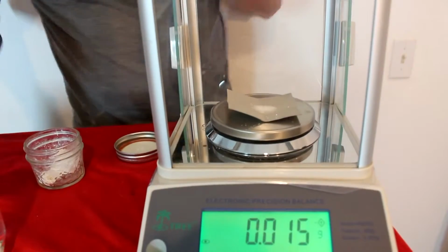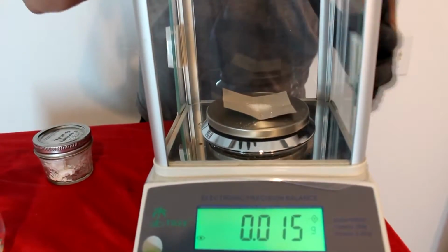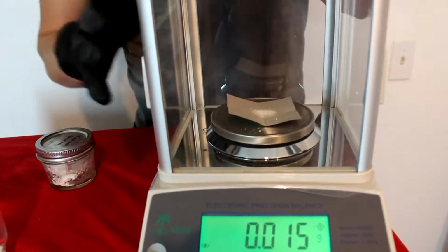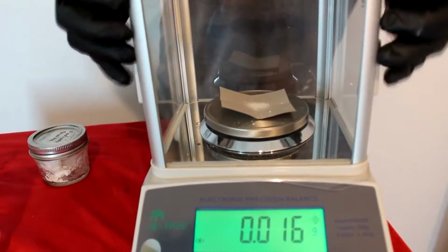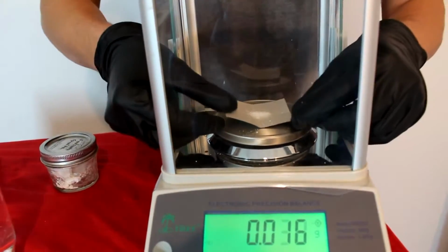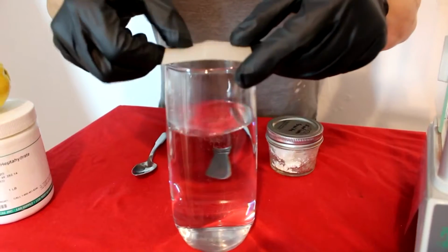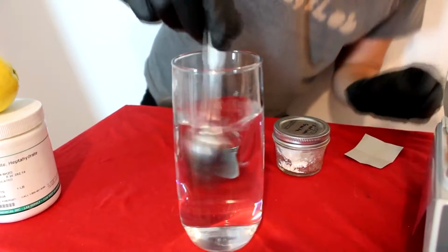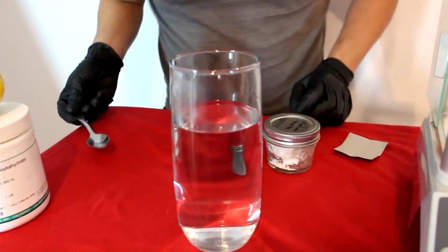Okay, so now I've got about 15 milligrams of that stuff. Let's close the shields on our scale, make sure that number's right. Alright, we went up to 16, that's absolutely fine. So now I'm going to take this and bring it over here to this glass of water. I'm going to tip it in, just like this, a little thump, a little stir. And now I have a solution of sodium cyanide in water.